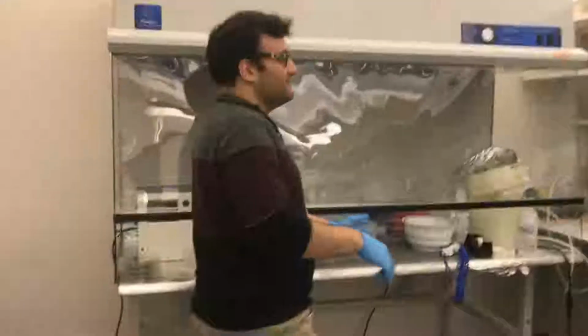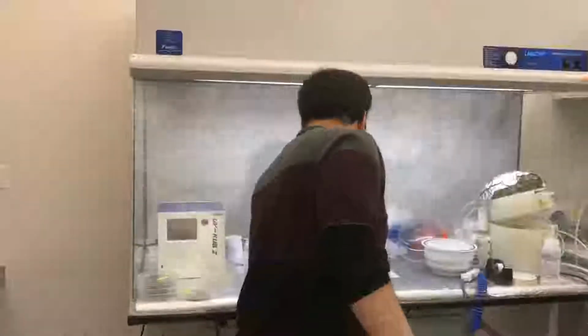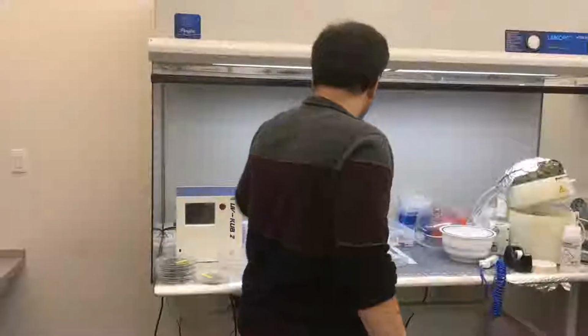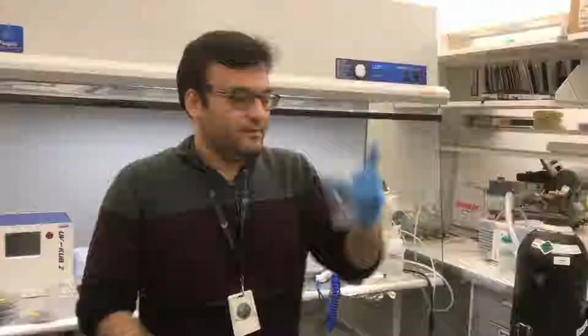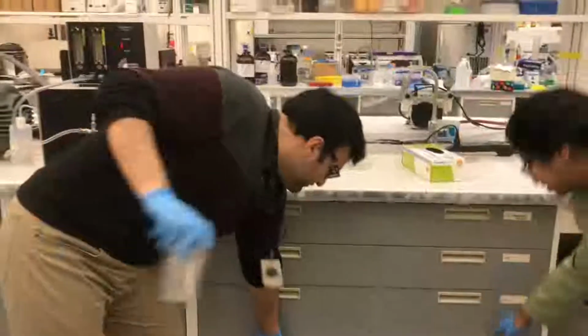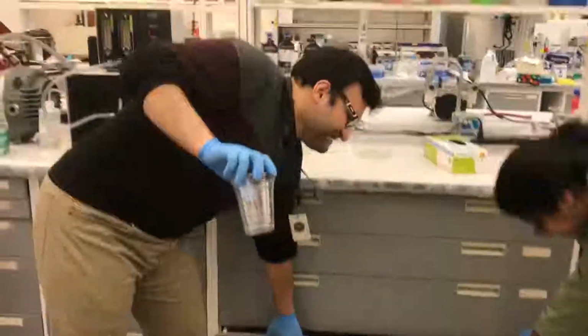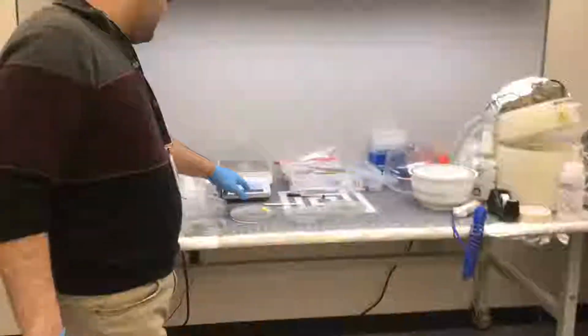Yes, okay. Good. At first we turn on the light on this one. Okay. Then there is a mug. And this mug is available? Yeah, it's here. From Walmart you can buy it. Okay, good. This is what you have to tell. And then, here, weigh the mug.